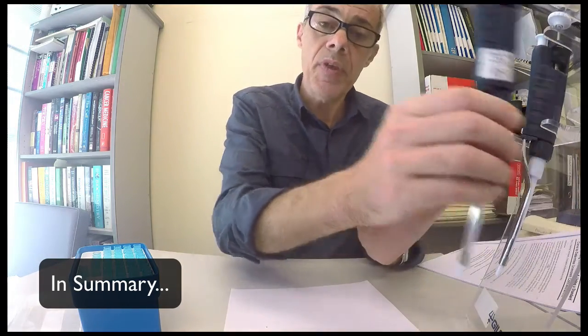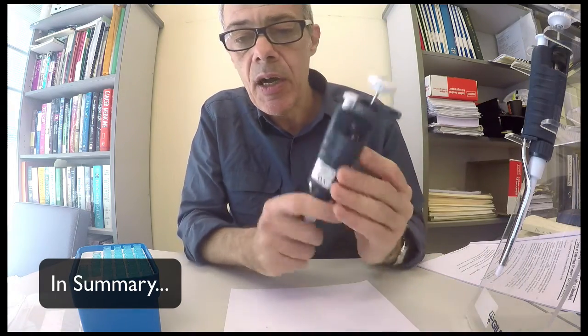So as a brief introduction to using micropipettes, hopefully that will suffice. Important things are the choice of the right pipette for the volume that you want to dispense. The next thing you need to be aware of is setting the appropriate volume here on the dial and not getting confused by the number.